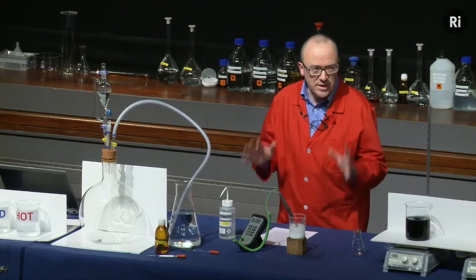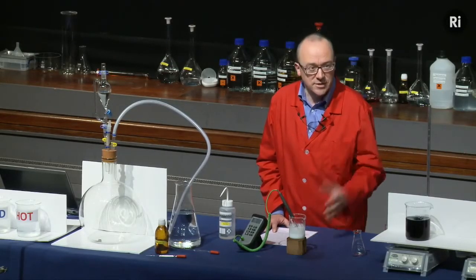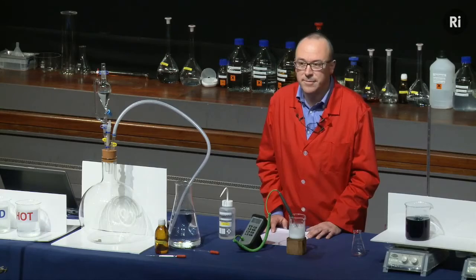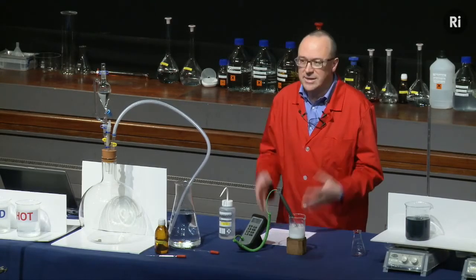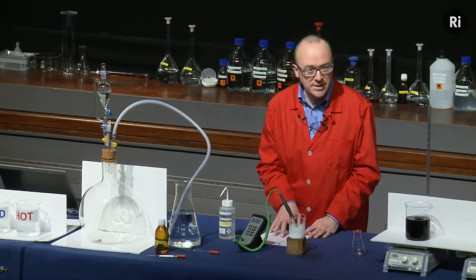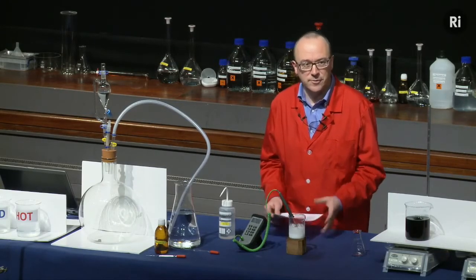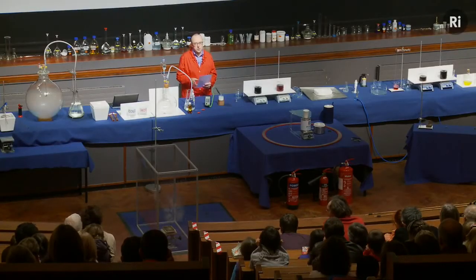His name was Ira Remsen, and as an adult he became very famous. He founded the chemistry department at Johns Hopkins University, and he discovered the first artificial sweetener, that's called saccharin. But as a teenager, he was curious about chemistry, and he used to do some little experiments. And I'm going to tell you a story, in his words, about an experiment which he performed when he was a youngster. Now, the experiment involves the reaction between copper and nitric acid.